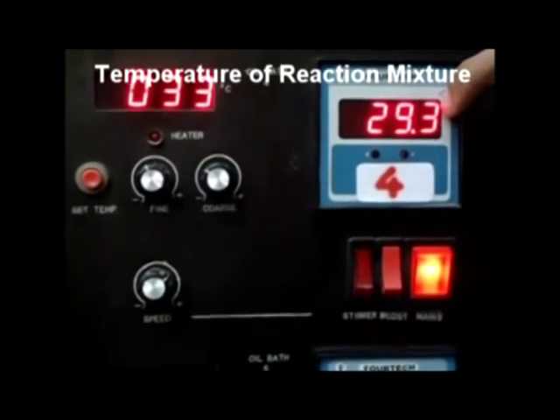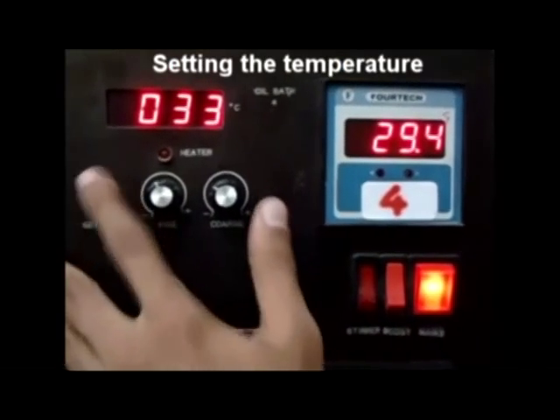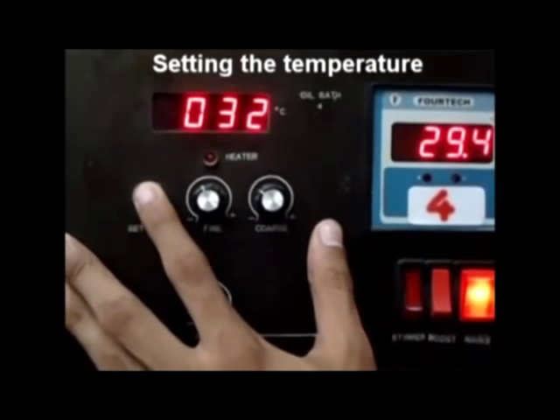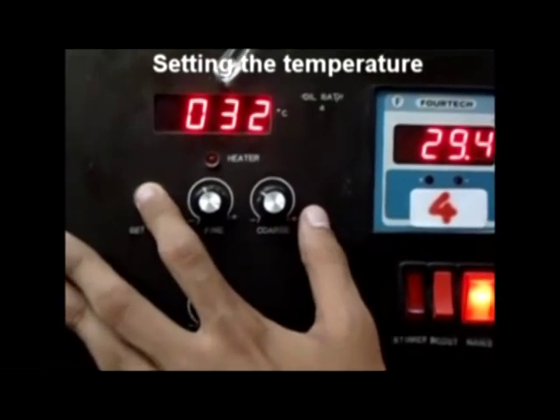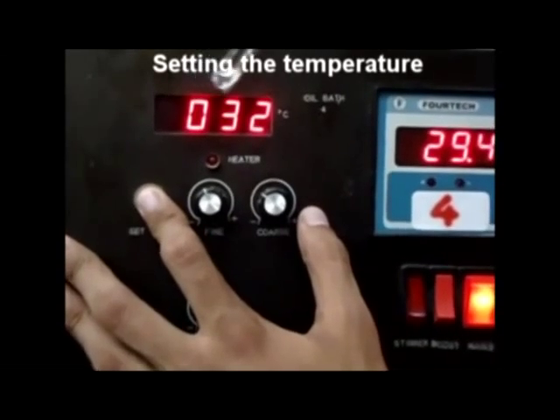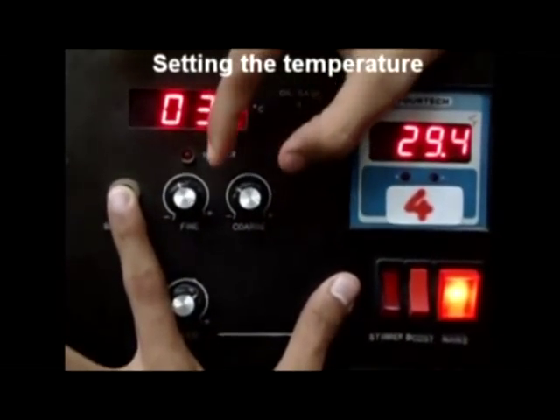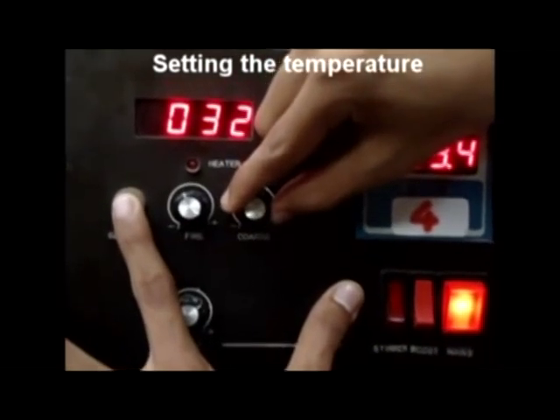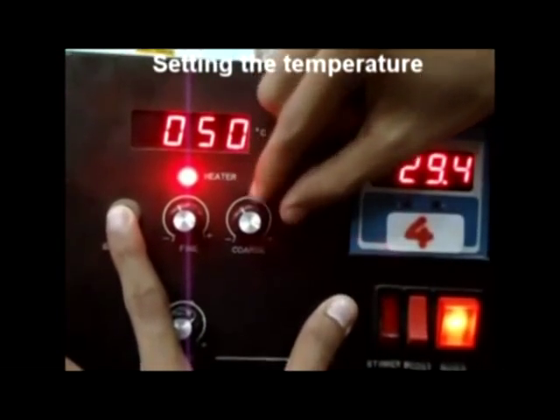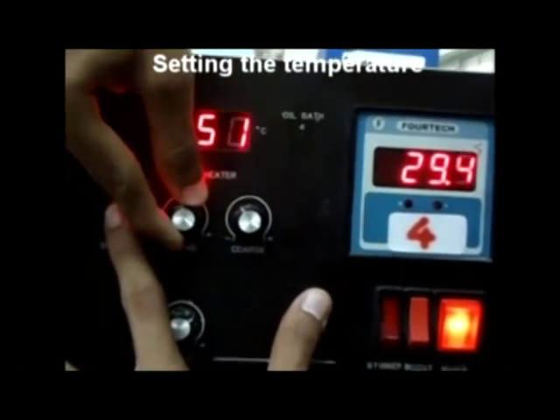This temperature reading indicates the temperature of the reaction mixture. When you press the red button, the set temperature is displayed and you can adjust it using the knobs. When you want to make large adjustments, use the coarse knob; use the fine knob to make small adjustments.